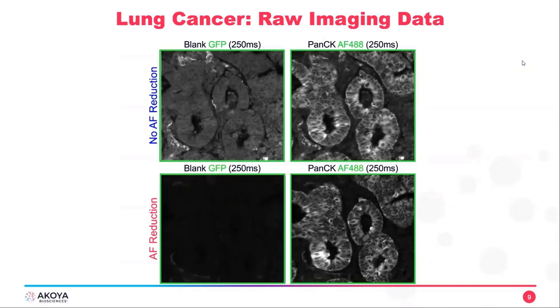So if we look at the top right panel, you can see that I have applied pancytokeratin. And again, you're seeing these epithelia with the pancytokeratin expression, but you're also seeing this background and even tissue abnormalities such as these. Now, I took a serial section of this tissue and imaged the same area, except I applied the autofluorescence reduction method. And in this bottom left panel, you can see that this is still the same region of tissue, but the background and autofluorescence are virtually gone. And then when you do add the pancytokeratin, you can still see this beautiful epithelia, but you're not confused or distracted by any of the background.